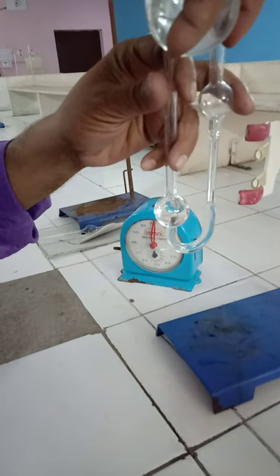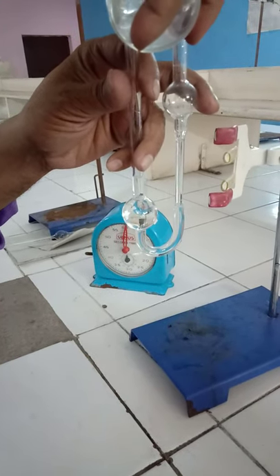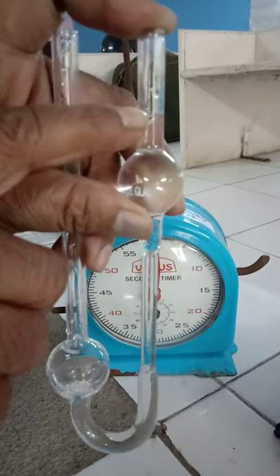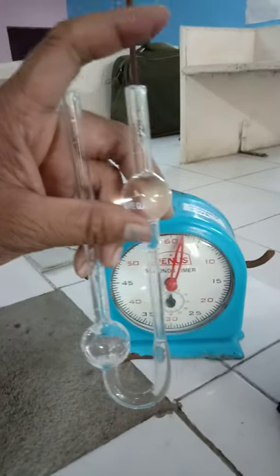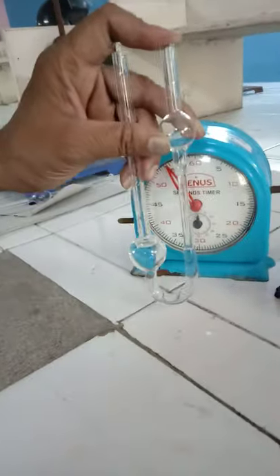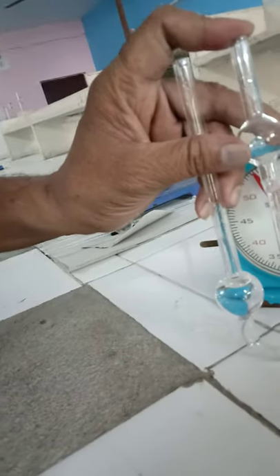Repeat the same procedure with ethyl alcohol. Suck the ethyl alcohol up to the upper mark, then leave your finger and start the stopwatch. Observe here — the alcohol falls from the upper mark to the lower mark. The time for ethyl alcohol to flow from upper mark to lower mark is noted using the stopwatch, which is 3 minutes 55 seconds.